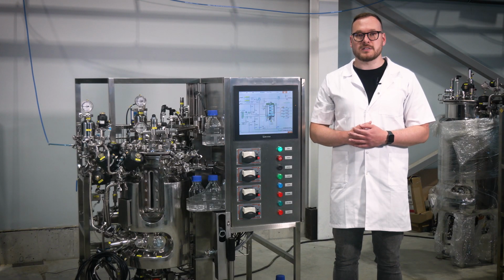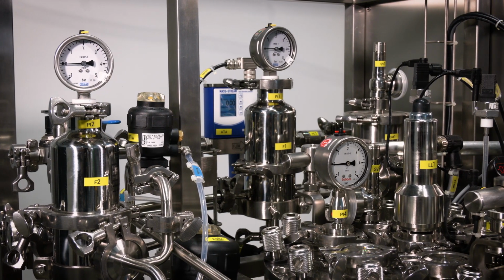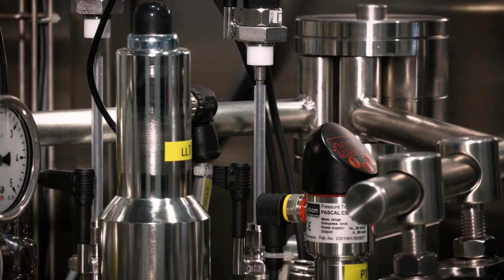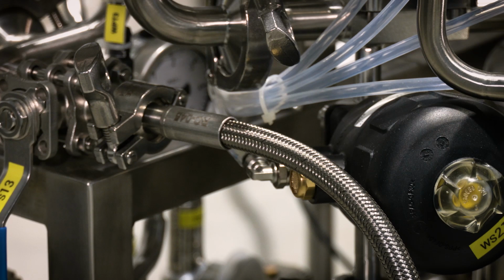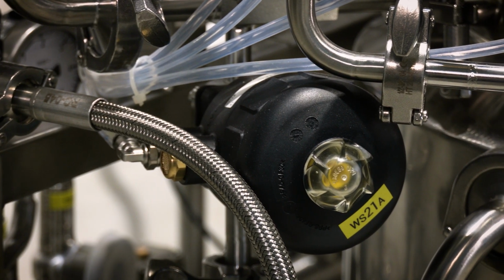Bioreactor air supply system. The bioreactor air supply system consists of two filters, one for the incoming gas and one for the exhaust gas. Both filters should be sterilized simultaneously. Before sterilization, open and check if the appropriate valves are opened according to the user manual.